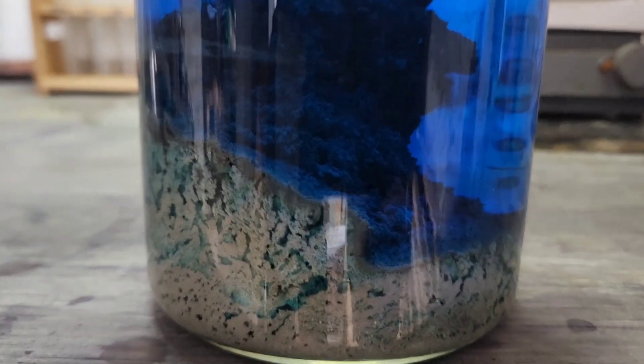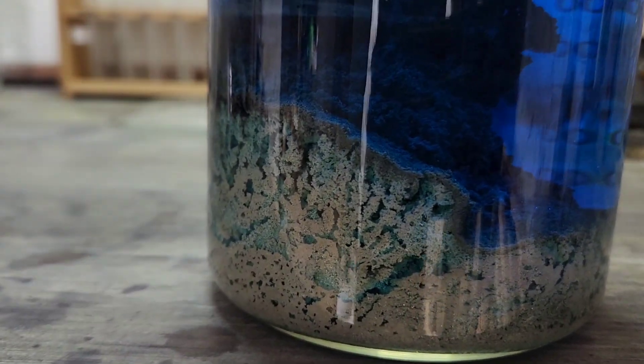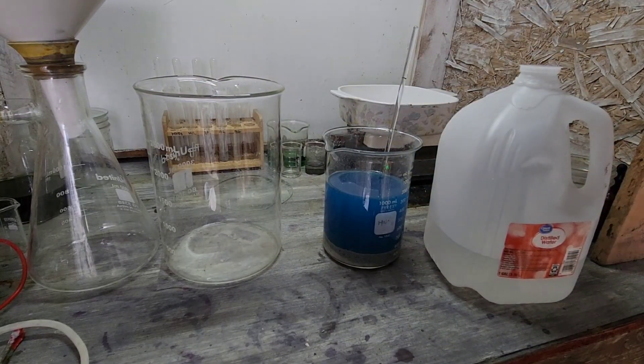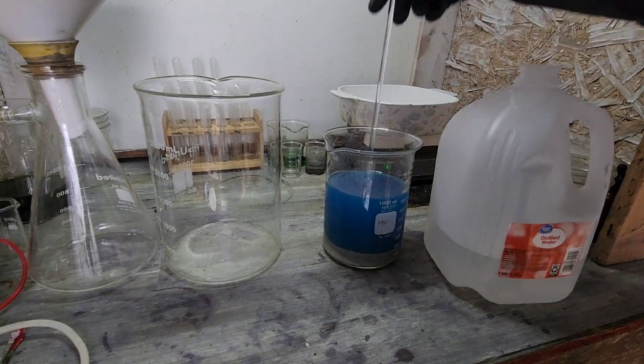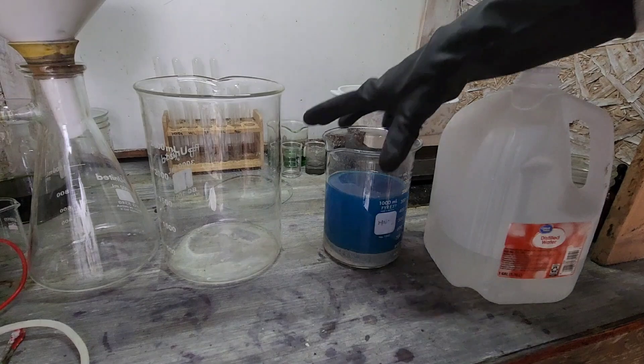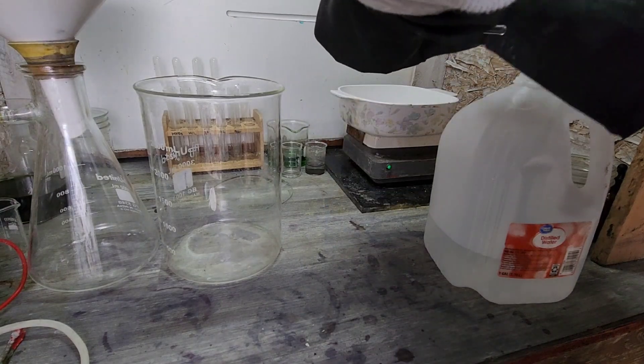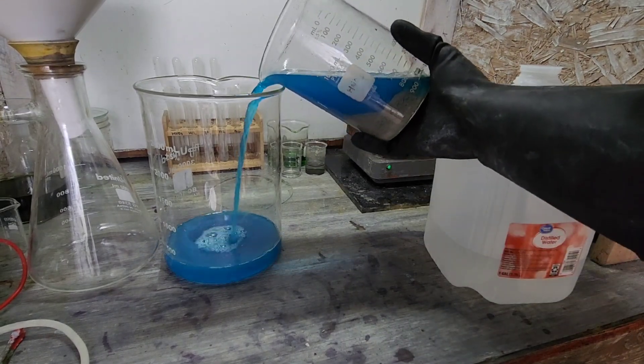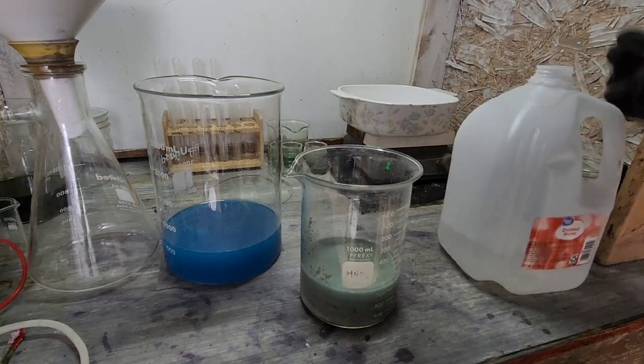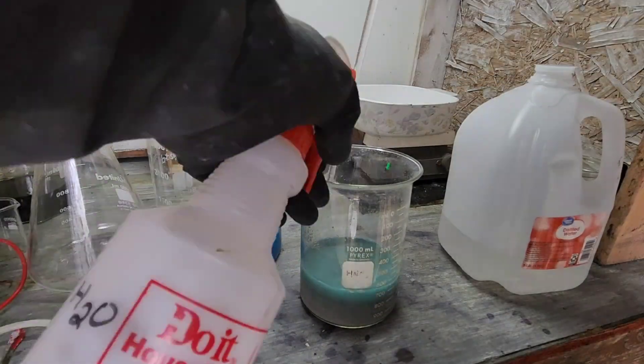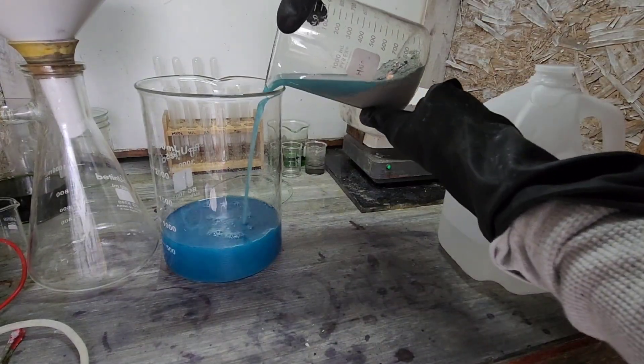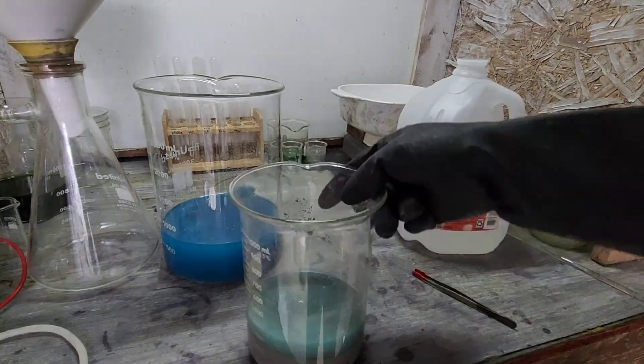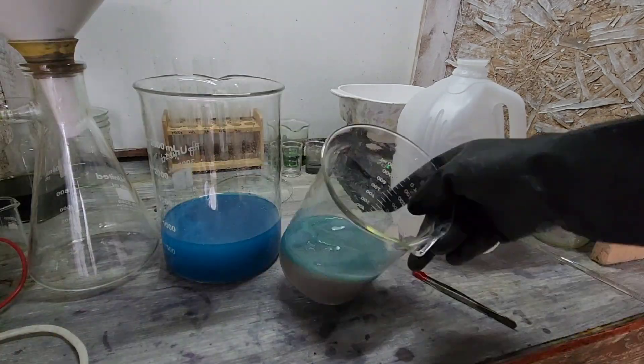All right. Whoo wee. Now that is some silver. All right, what do you guys think? A couple rinses on this before we dehydrate it, see if we get some of that copper off of there. That feels pretty heavy. That feels pretty heavy.